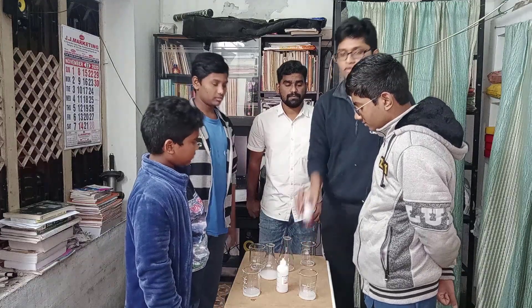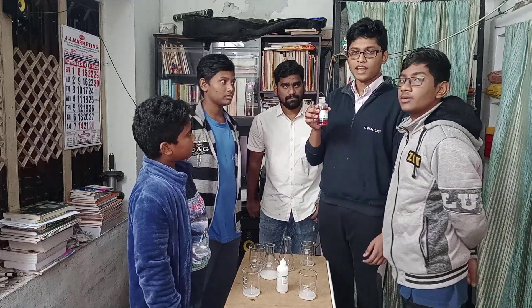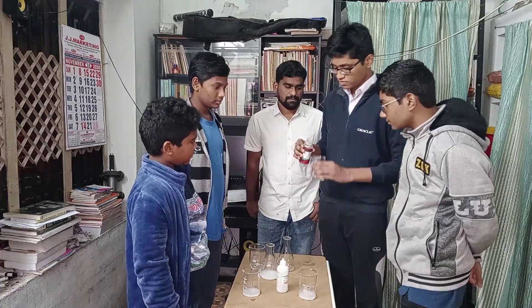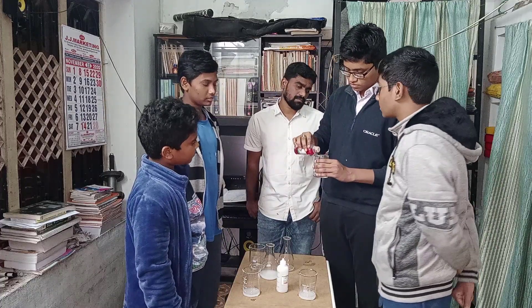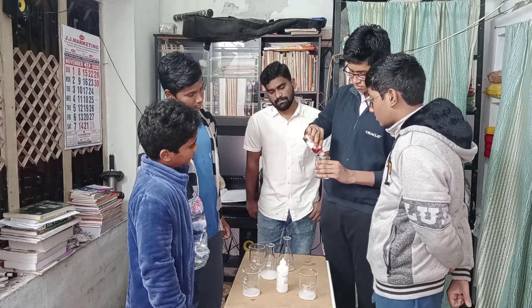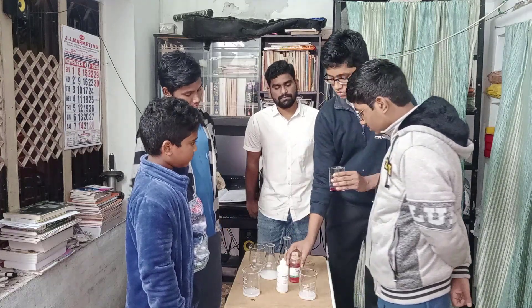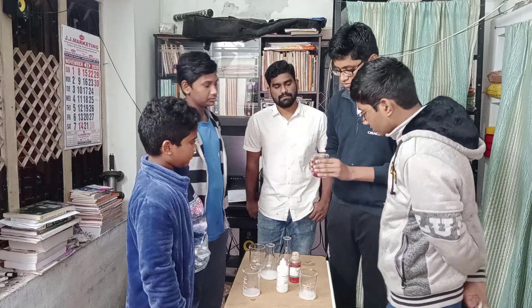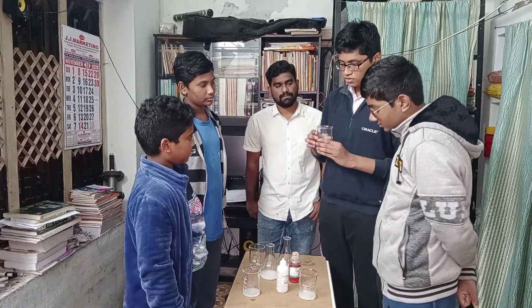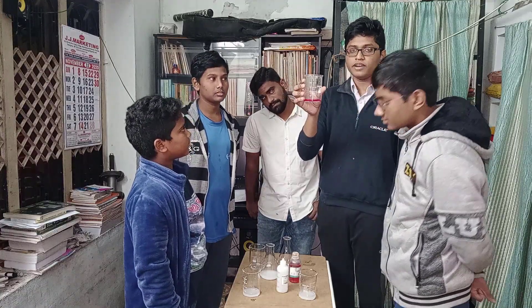Now we are adding 2-3 drops of methyl orange in the acid. It turns into red color.